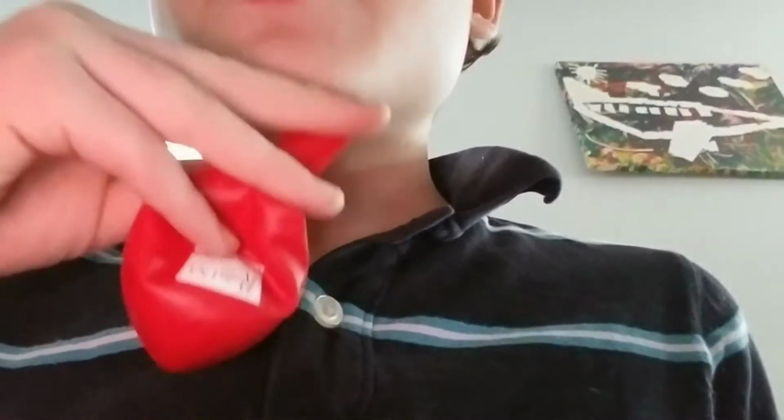The second stupid mistake that I made was I used balloons. And you see, the problem with this is that since they produce so much pressure, and I only had one side covered with the balloon, it pushes that side's water level down and pushes water into the other side of the electrolysis rig, since it is a double cell, and causes the other side to flood, and it caused a bunch of problems. So nonetheless, that is the biggest mistake that I made in this video. And I strongly suggest using a garbage bag instead of a balloon to fill up your electrolysis rig.